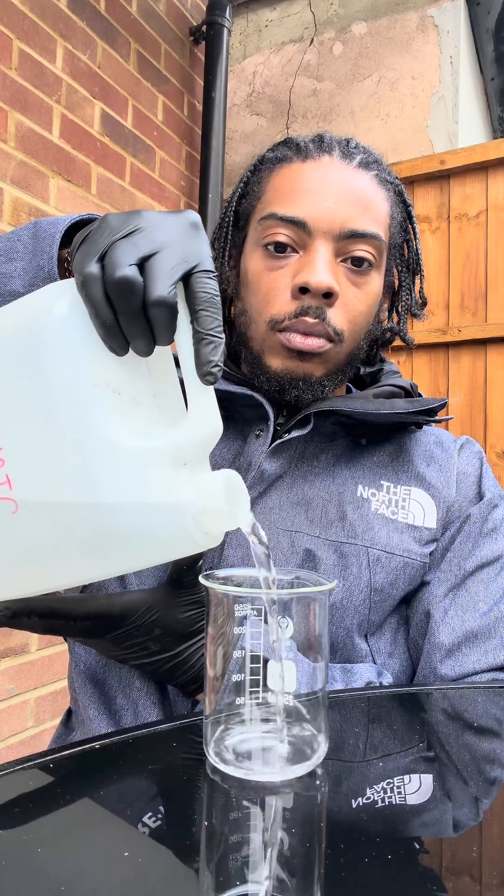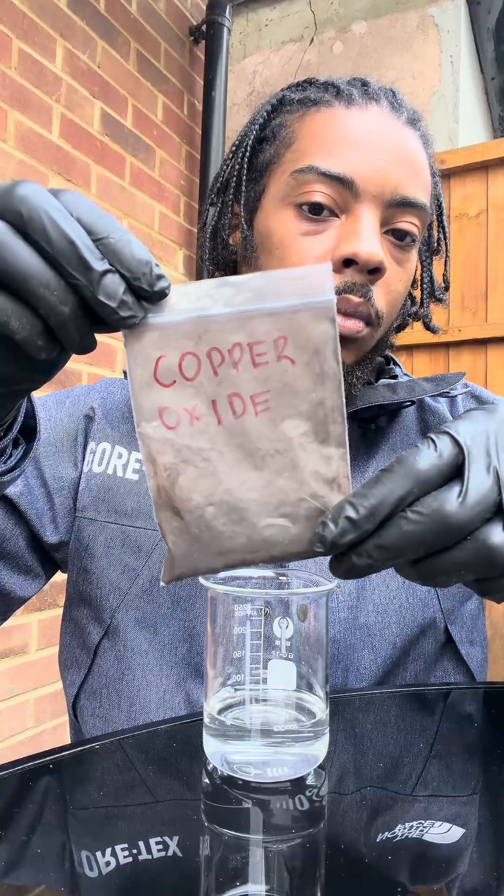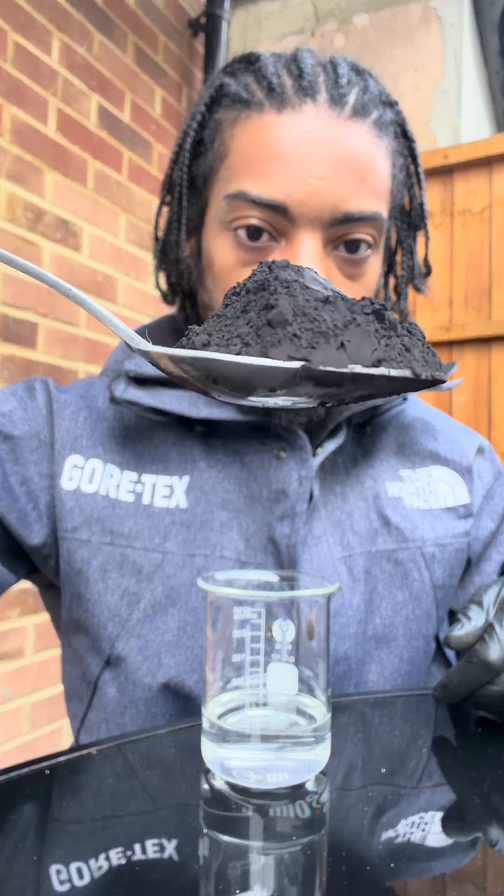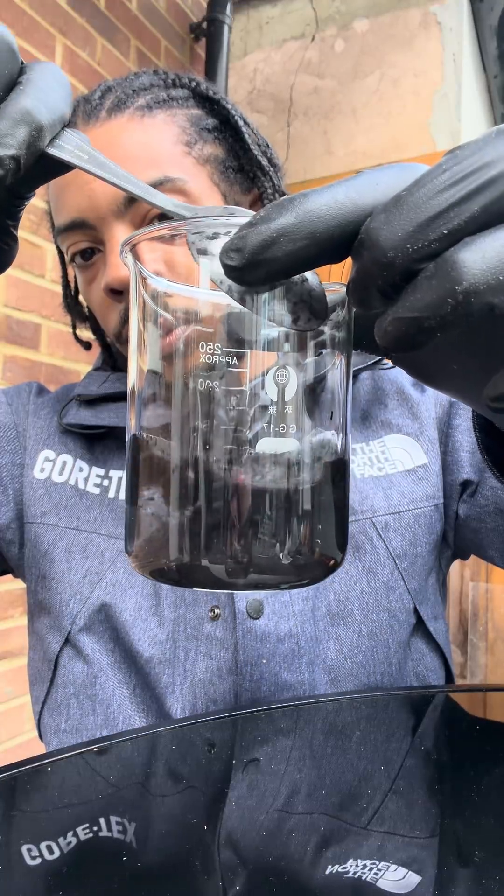So first, I need a little sulfuric acid in that. And I'm going to mix that with some copper oxide, innit? So obviously, I'm going to put excess copper oxide — which means I'm going to put loads in it — because obviously I want all the sulfuric acid to react in that.